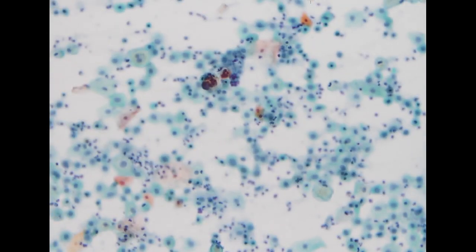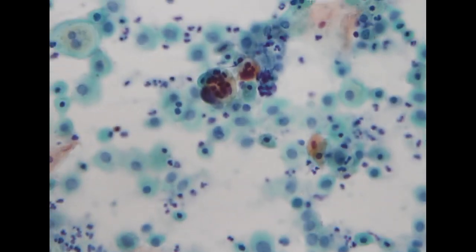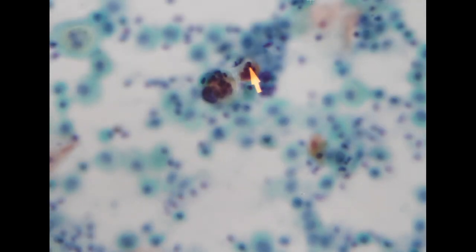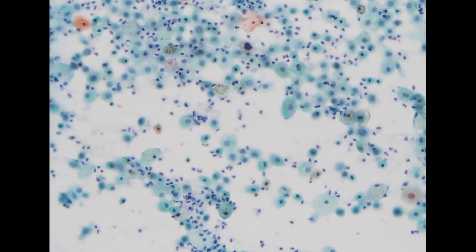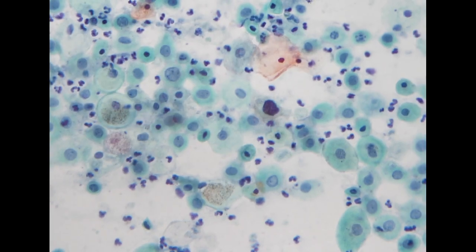The second specimen is not very cellular. There are a couple of dots. The dot over here, although you see some orangeophilic staining, is most likely a phagocytosing, degenerative cell. So these most possibly come from the endometrium. So there are very scattered endometrial components. This one looks like the cell membrane is not very apparent. It can be a naked nucleus. If it is a naked nucleus, we don't make an interpretation on that.